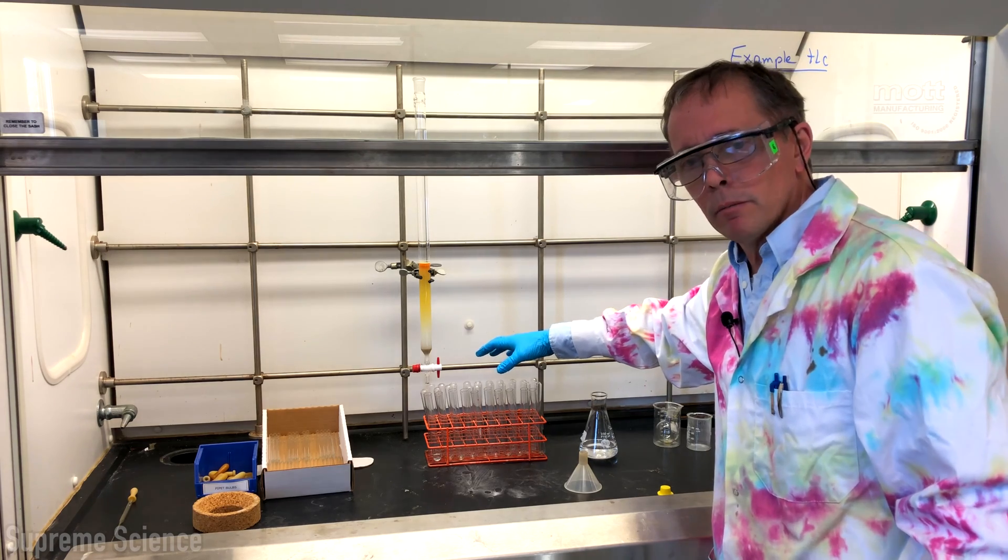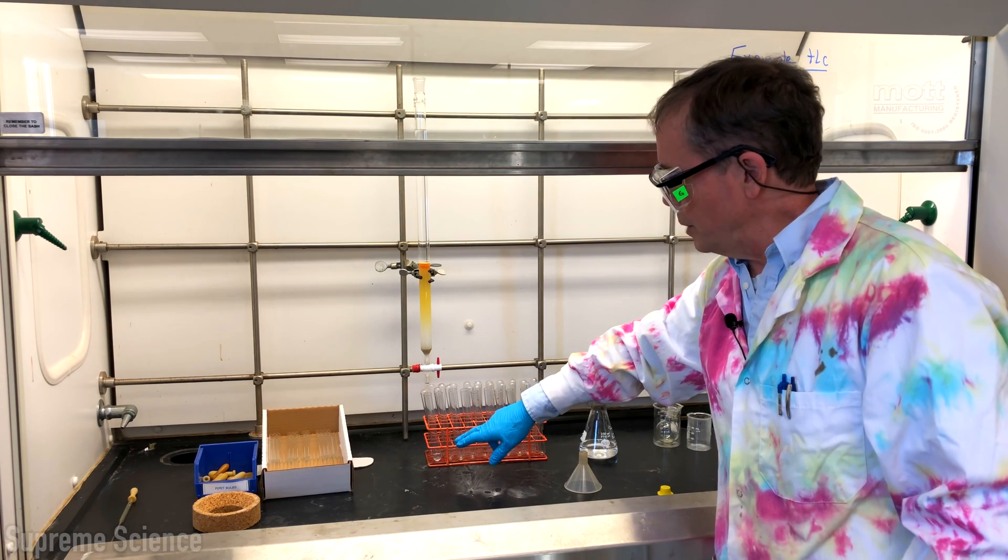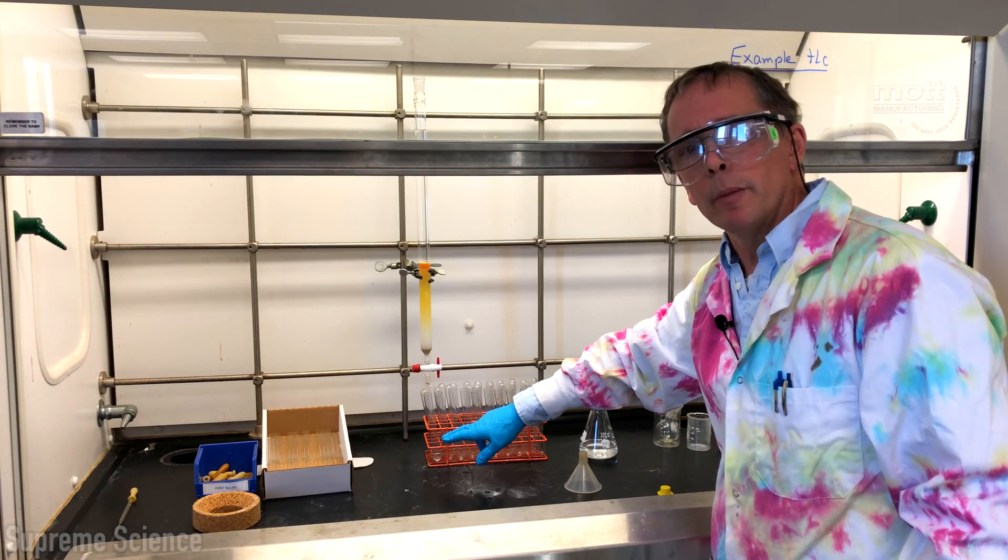One hour later. We're going to collect approximately 5 to 10 mils in each test tube, which is going to be about 3 to 4 centimeters up the tube.